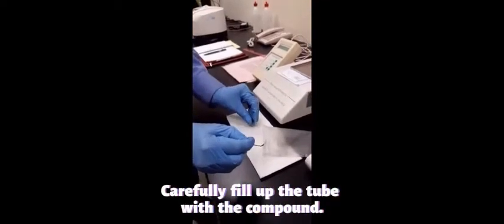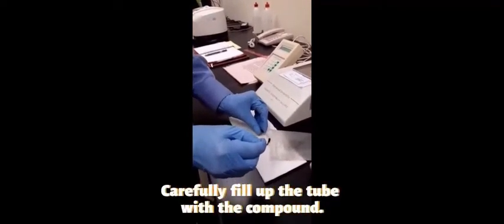Insert the sample slowly and tap a bit so that the sample is completely packed.